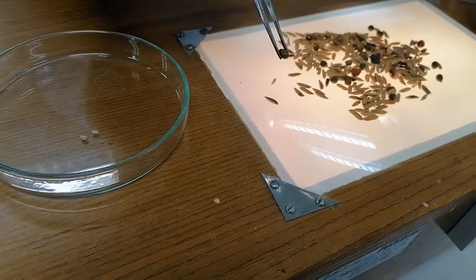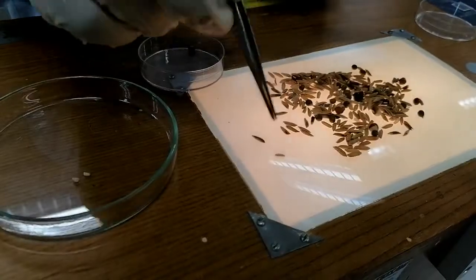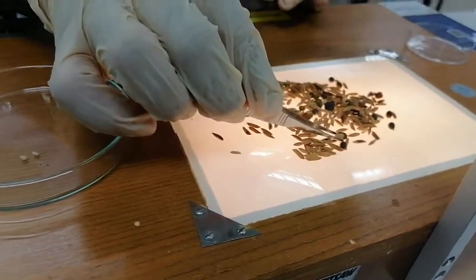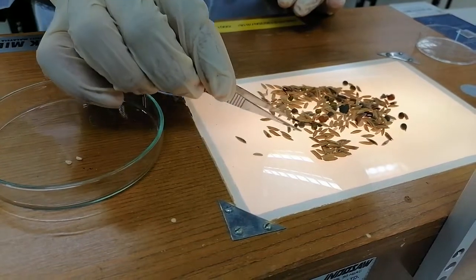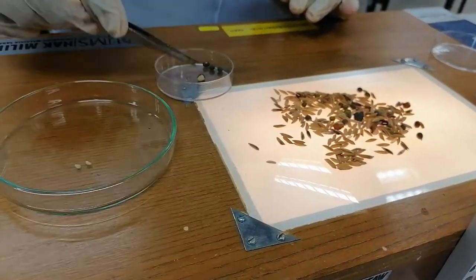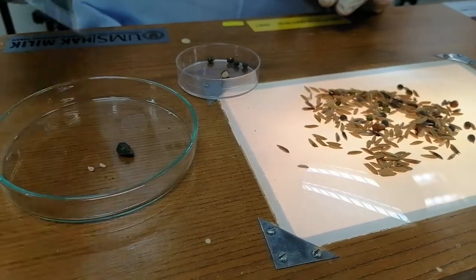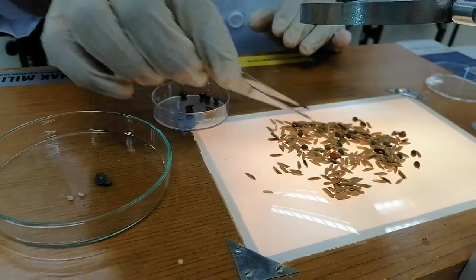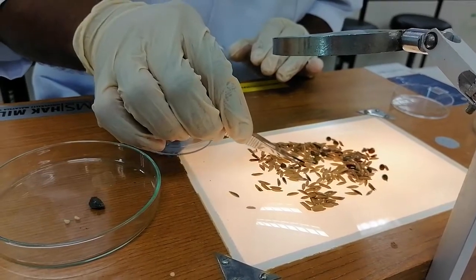Some of the rice pieces are less than half, so you have to consider these as inert matter, not pure seed. This is another crop seed — this is mung bean seed — so you have to keep it in another pot. One by one: this is inert; this rice is more than half, so we can consider it as pure. This one is another crop seed. This one also is another crop seed. We have to separate them one by one. This is a stone particle, which is considered inert matter. Any other plant parts are also considered inert matter.